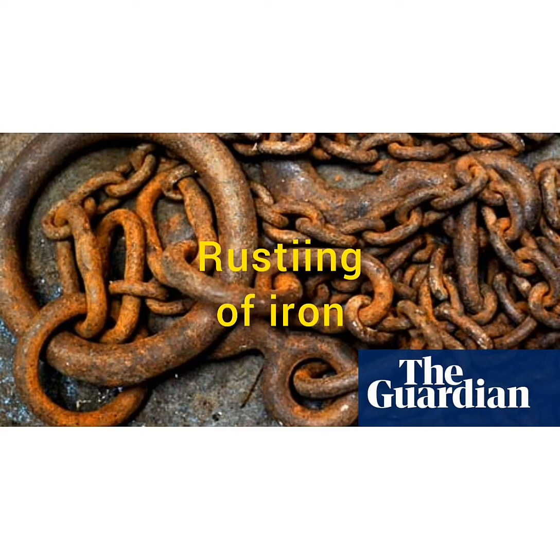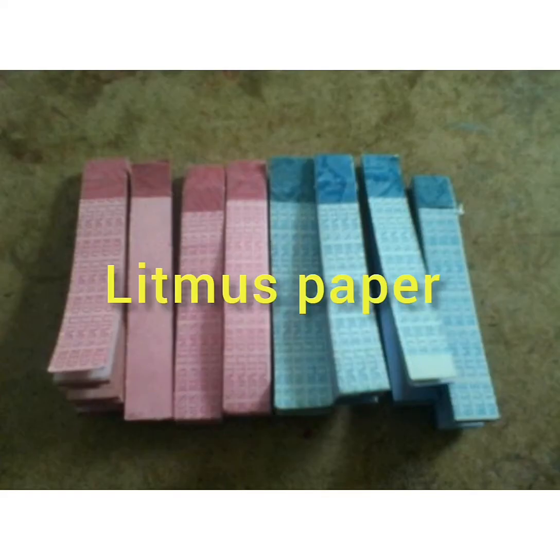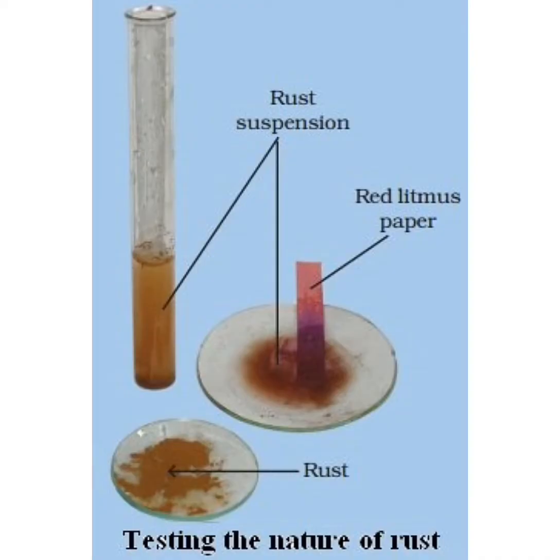rust is formed. To test the nature of rust, you need a test tube, rust suspension, a small spoon, some water and blue and red litmus paper. Take a spoonful of rust and add it to a small amount of water taken in the test tube. You can see it forms a suspension. So shake the test tube very well to dissolve it. Then you have to take blue and red litmus paper to test the nature of rust.